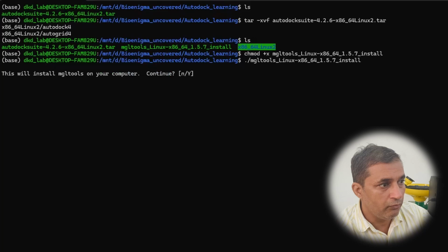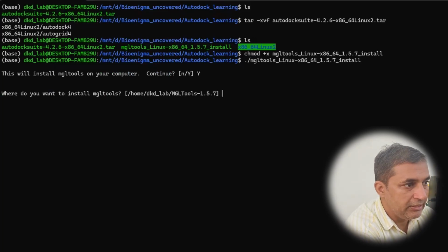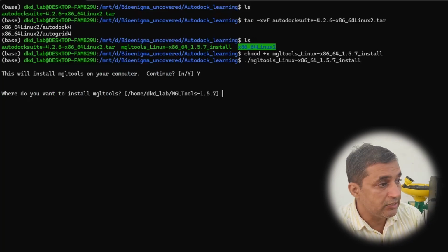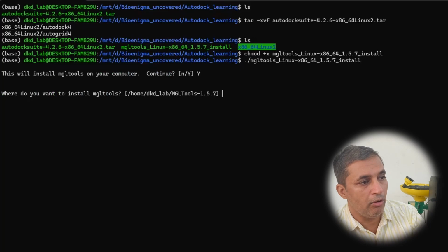This will install MGL tools on your computer. Continue. N for no, Y for yes. Of course, type Y for yes. Hit the enter button. Then again a prompt appears on your screen. It says, where do you want to install MGL tools? home, dkd_lab, MGLTools.